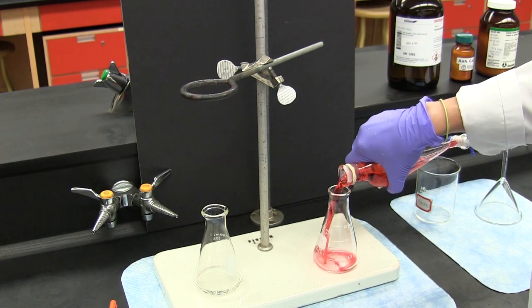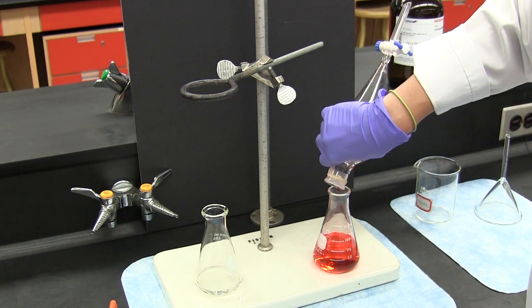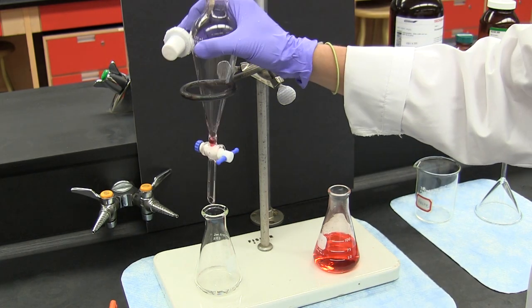When you are finished with the upper layer, it is poured out of the top of the funnel. You should pay attention to your script in the lab manual and follow whichever procedure is given.